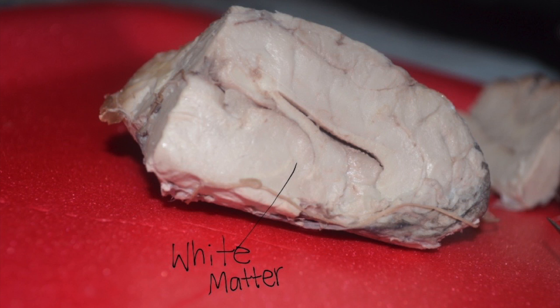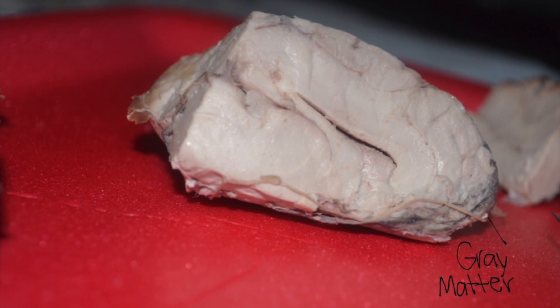The colors of the surface and the tissue inside the brain are different. The tissue inside the brain is called white matter. The white matter is actually made up of axons, nerve fibers that carry nerve signals. The outer layer, which is darker, is called gray matter. Gray matter is made up of nerve cells that process and transmit the nerve signals.